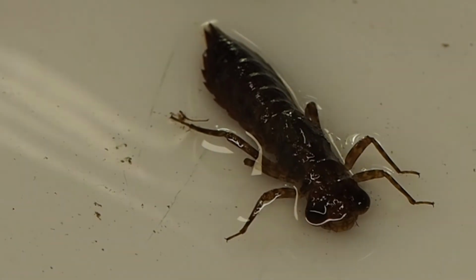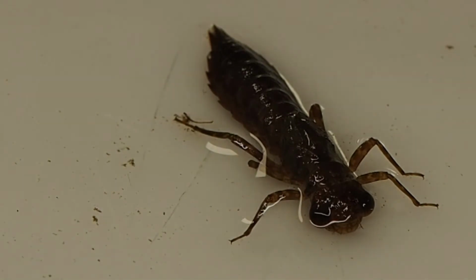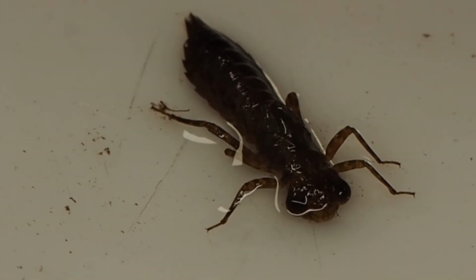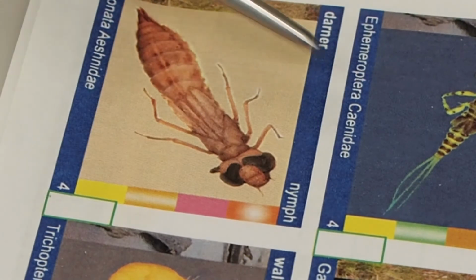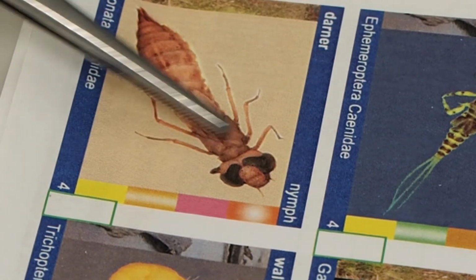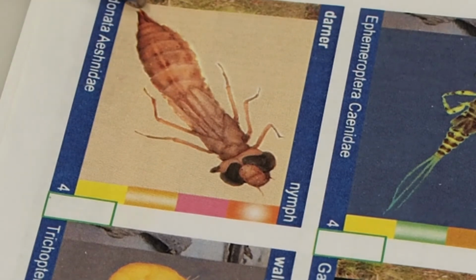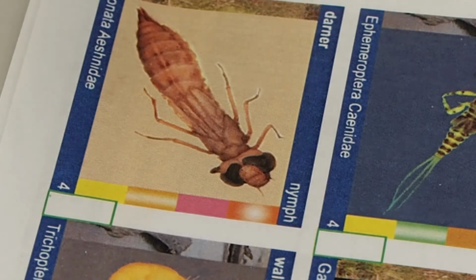Okay, so head, tail, and general body shape are really the distinguishing features. So if I now swap that out to our guide, and I'm going to switch it out to see how this goes. Yep. We can see that, and because I've already looked by flicking through the guide, you can see this one here is very similar in the body shape, the head shape, short antennae, short tail region, obviously 6 legs. So the key features are very similar, and although the colour's different, once again, colour is probably not a good indication for most things. It's the body shape and the key features that you need to be looking at.